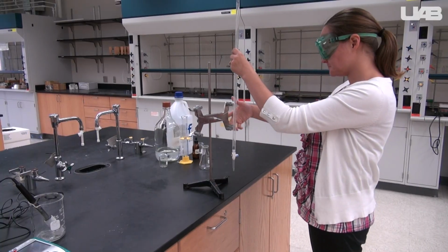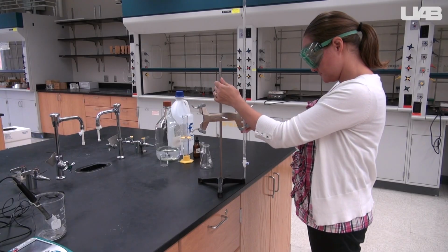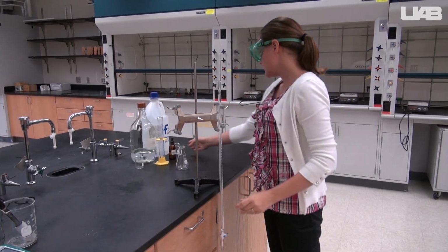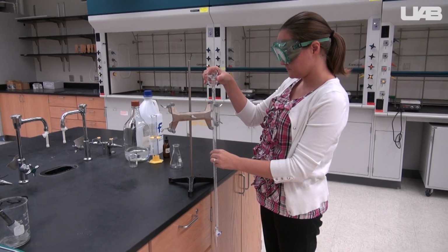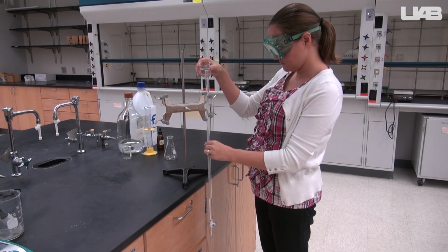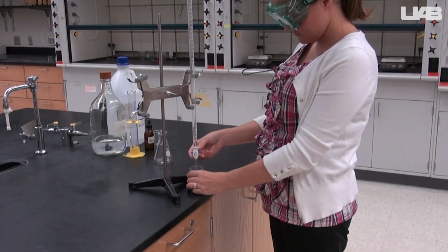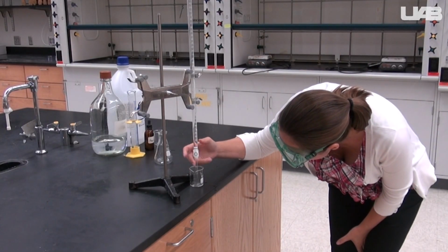Prime your burette, make sure your stopcock is in the horizontal position, then fill it up with the sodium hydroxide stock solution to about 1 to 5 milliliters from the start of the graduations. You may find it helpful to lower the burette off the side of the lab bench like this, so that you do not have to reach to pour the sodium hydroxide in. Allow some of the sodium hydroxide to flow through the tip and make sure to tap out any bubbles.